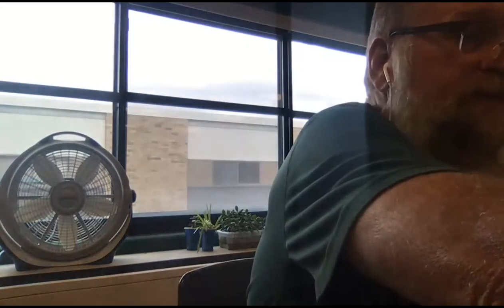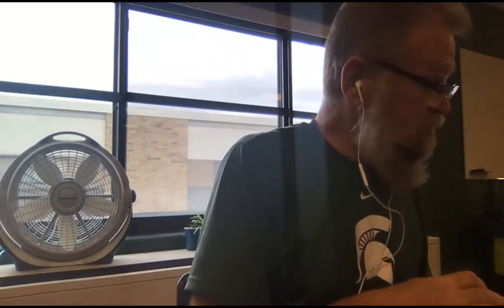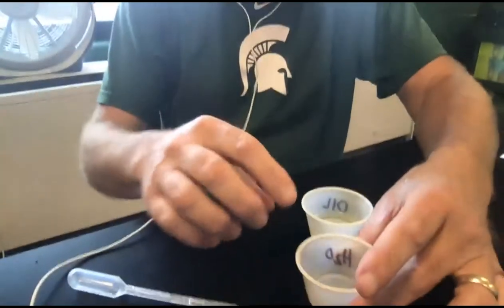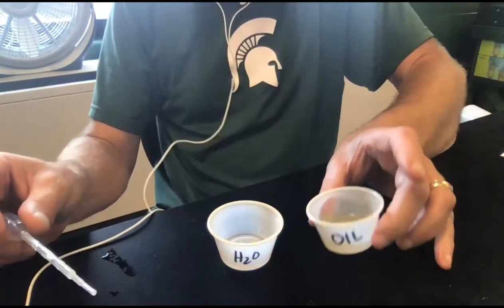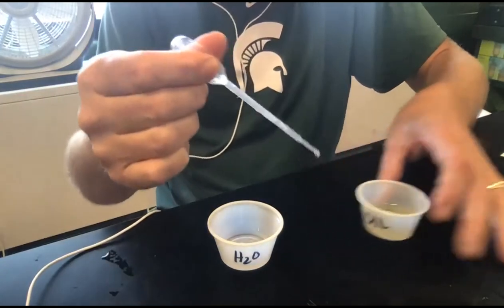And in one of them, I'm going to, oh, I'm jumping ahead of myself. All right, so sorry, one of them gets water, not both of them. And I'm going to put a drop of oil. So here I've got my cup of water, H2O. And here I have my oil, and I'm going to put some drops of oil into this container.